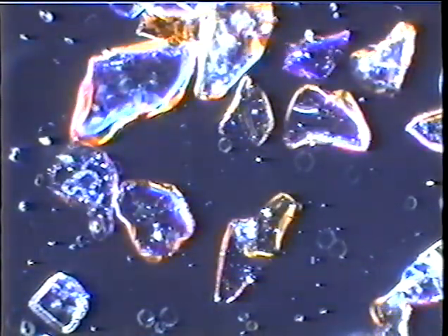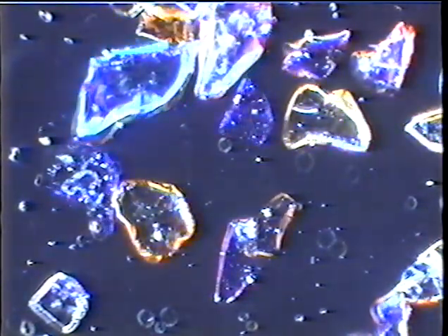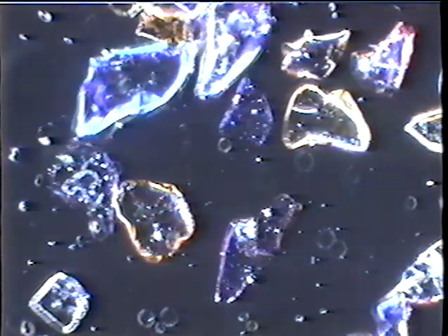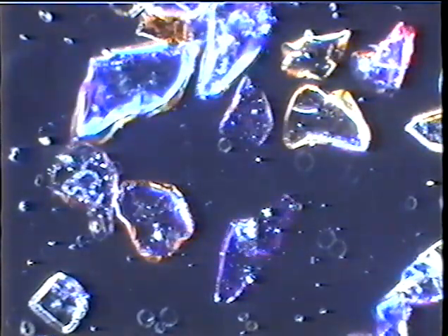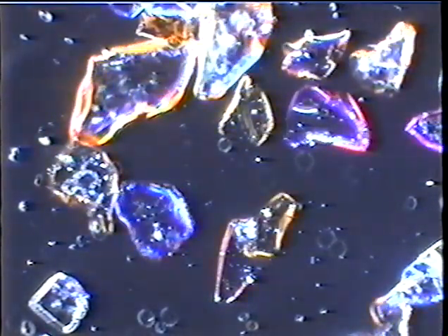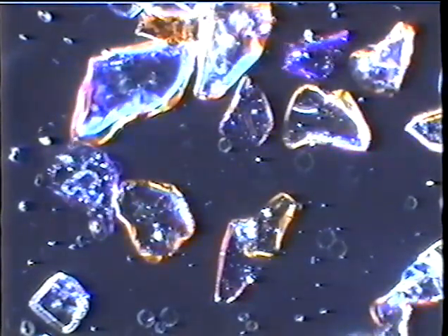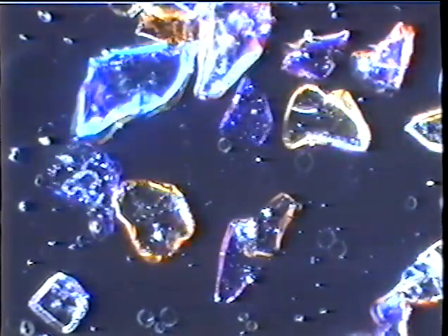There are other things that we can do under the microscope to help us recognize things more rapidly. These colored crystals are a colorless mineral, olivine, that we've treated in an optical manner to give these colors, which depend on their orientation and thickness. This is called dispersion staining, and the mineral is called olivine.